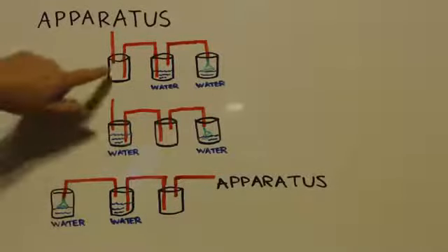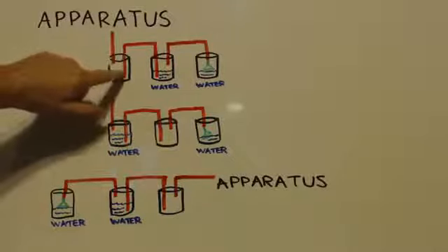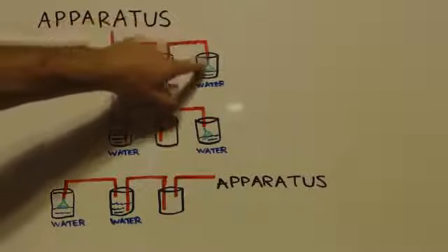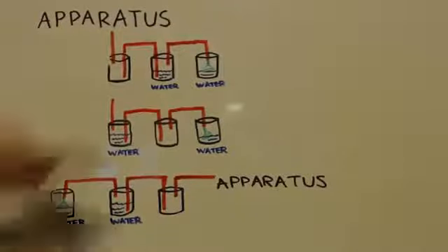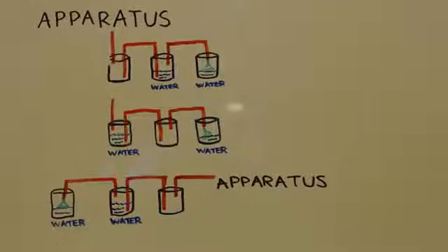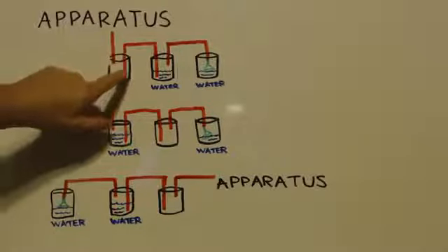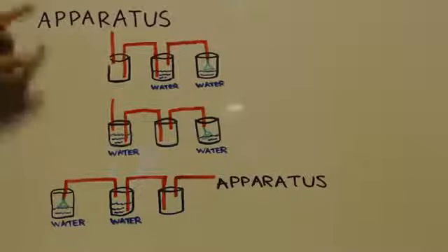What's going to happen here is this one's empty, right? Now, pressure pushes the gas through here, comes out, fills this bottle up, pushes it through here, and it bubbles through water. Comes out of the water, and it can come out of here to that funnel. Now, you set that funnel exactly right onto the water level, and that way, when it sucks up, let's say that it gets cold over here. Let's say you're making chlorine, and now all of a sudden the chlorine stopped being made, so there's no gas coming through here. So what's going to happen is you're going to have a vacuum, and you're going to suck everything out of here. When this gets sucked out, this water will be drawn through this tube into this canister instead of into the apparatus.